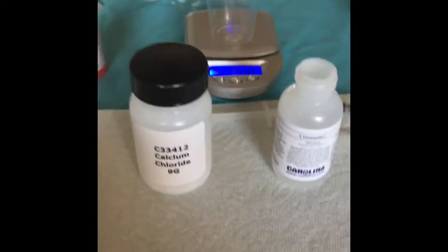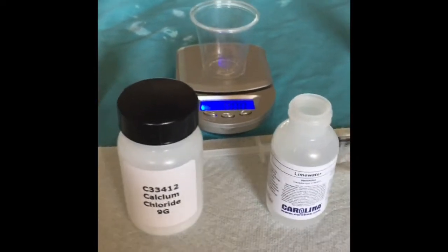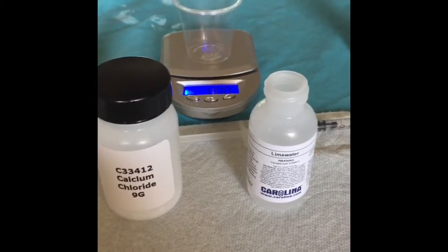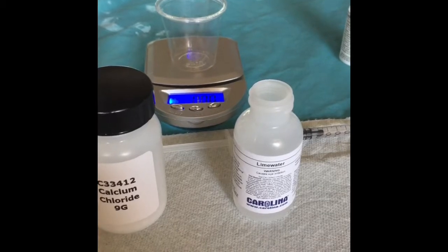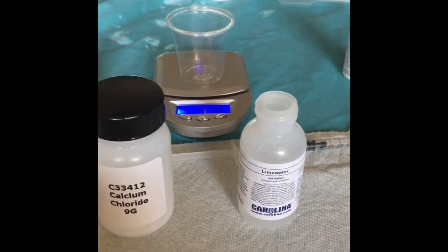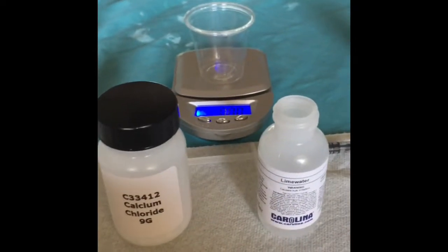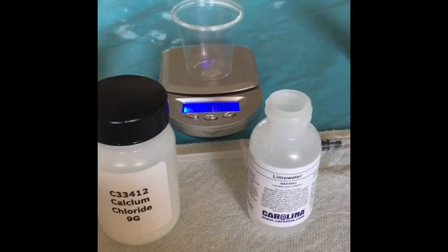Okay, so moving on to activity 2, I just finished all my calculations for the first activity, and so now I am beginning the second part. I'm going to go ahead and weigh approximately 0.03 grams of calcium chloride before I put it in the bottle, because knowing me, I will mess it up if I just start adding it to the bottle, and I won't have a redo if I do that.